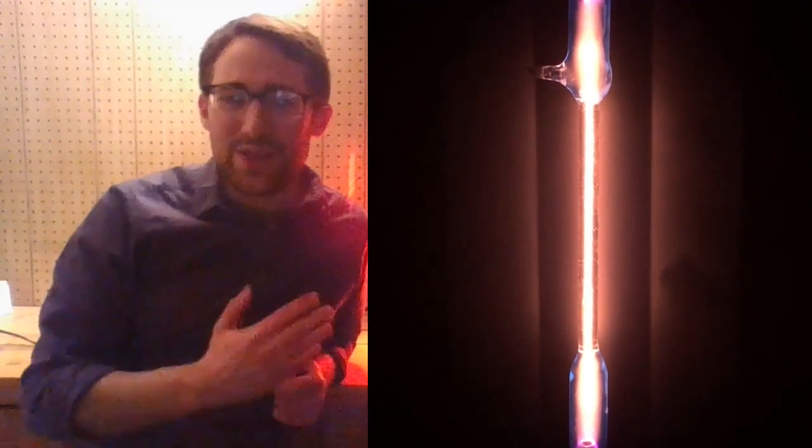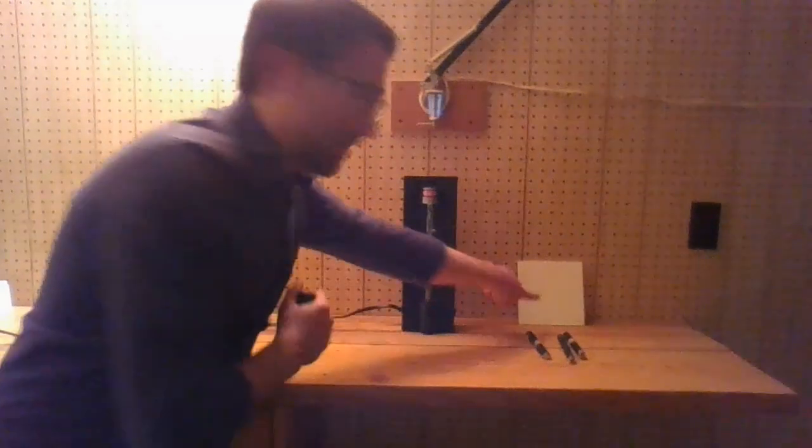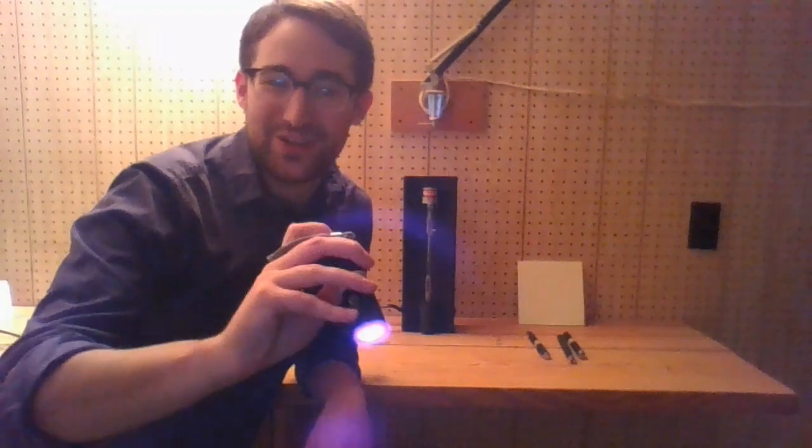Electricity isn't the only way we can excite the electrons in an atom. We can also put in light and then get back out light. One of the most fun examples of this is glow-in-the-dark stuff and fluorescent stuff. Whenever you see something that's glow-in-the-dark, like this little pad over here, I'm going to beam this with some high-energy ultraviolet light — not really good to look into, but it's kind of a purplish color. It's what we would call ultraviolet light. The part we need is the part we can't see, but the part closest to it that we can see is that violet light, so that's why it looks kind of purple.